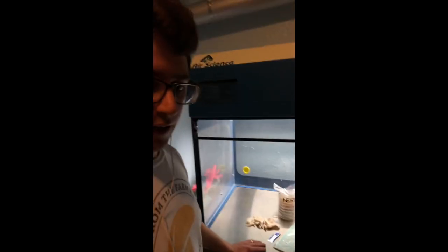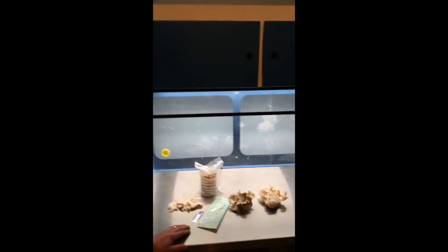What's up guys, this is Gary with Fresh from the Farm Fungi. I'm here in my lab in Denver, Colorado and I'm going to be sharing with you guys today how I cloned some oyster mushrooms from a poly spore culture.